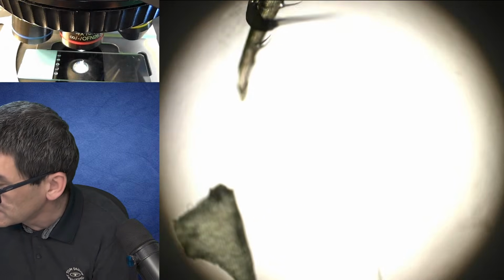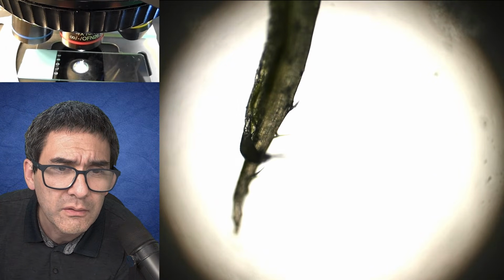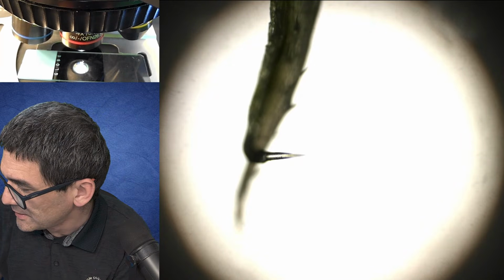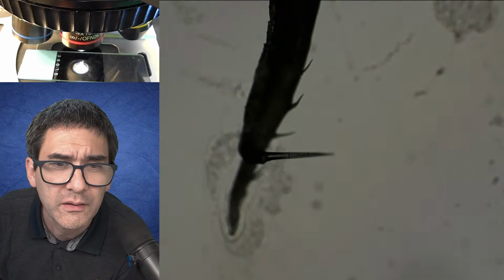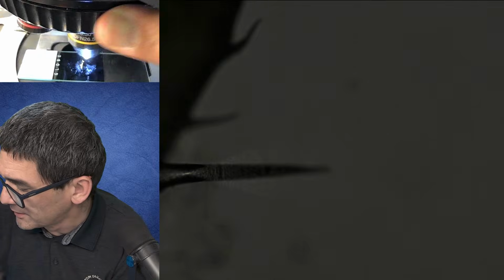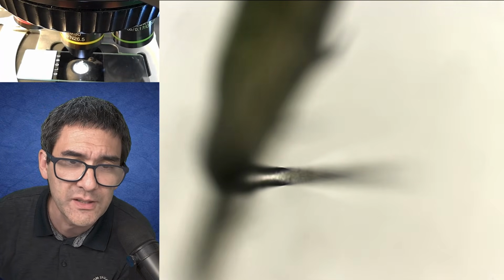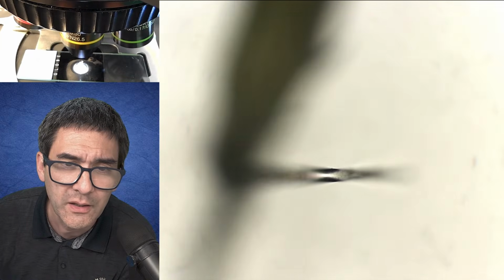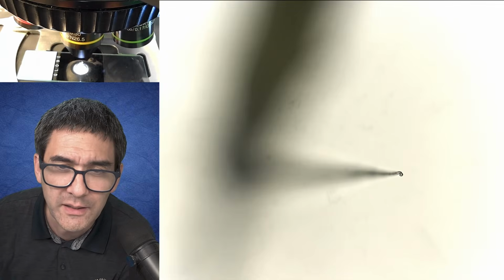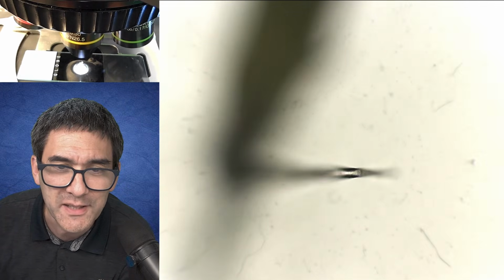And actually, this is it. Look at this, look at this. This is actually not so bad. Not so bad. Not so bad. This is without water, without anything, and it's not flat. Therefore, you see, if I focus all the way through here, this is a tiny droplet maybe here. There seem to be spines on the spines. I don't know if this is, yeah.